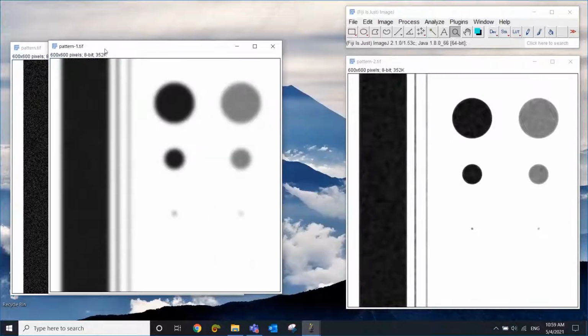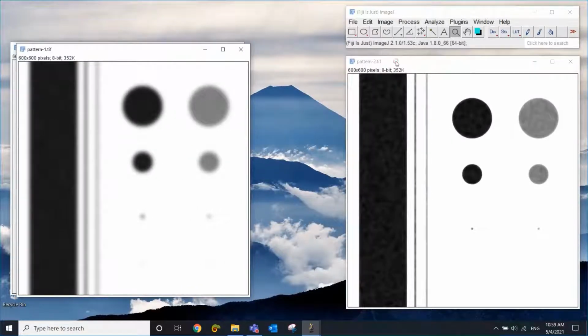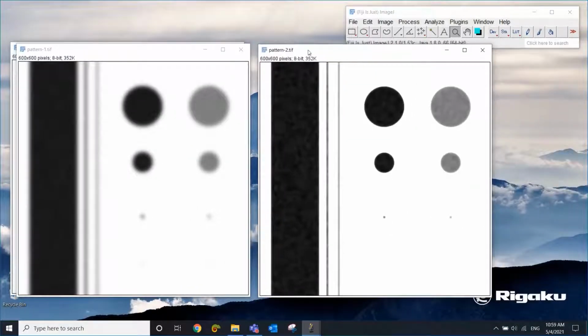So let's compare the results. So this is the Gaussian blur and this is the median filter. Both of them use the 5 pixels as radius. And you can see that Gaussian filter might have done a better job getting rid of the noise, but again, you're just blurring out the edges, which is not the case when you use a median filter. So this looks pretty good. So let's say I'm going to keep this one.